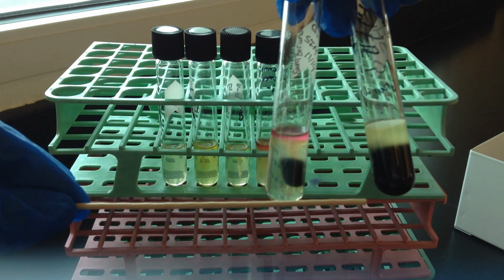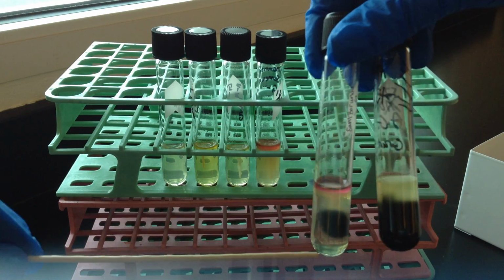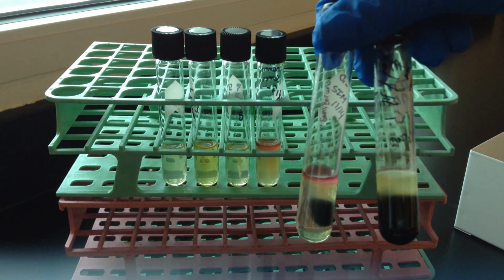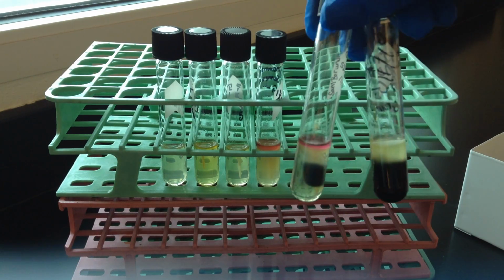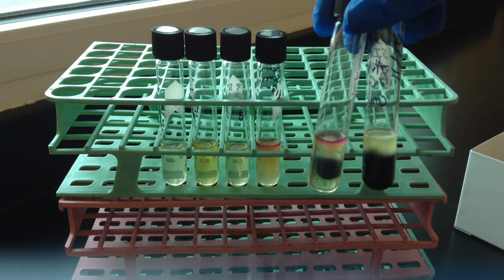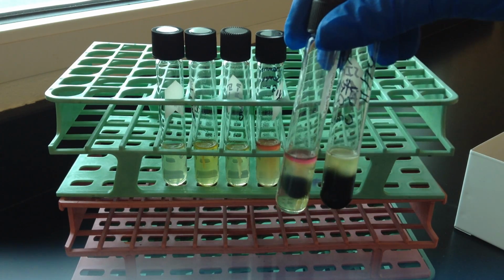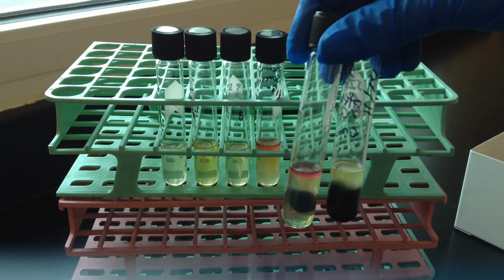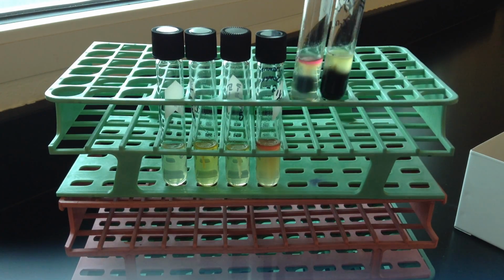Again, we associate the black color with motility, but here, which is nice, we can look at organisms that don't produce the black. We can examine them for motility as well. It's key, again, that you produce a good stab into the deep so that you can really read those results. So the black here shown in the tubes I'm holding up indicates that the organism has cysteine desulfhydrase or thiosulfate reductase. So they would be positive for the S part of SIM, the sulfur production.